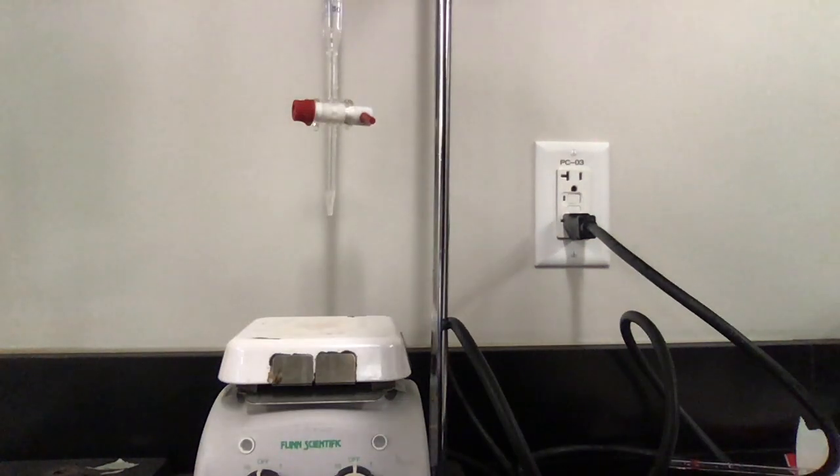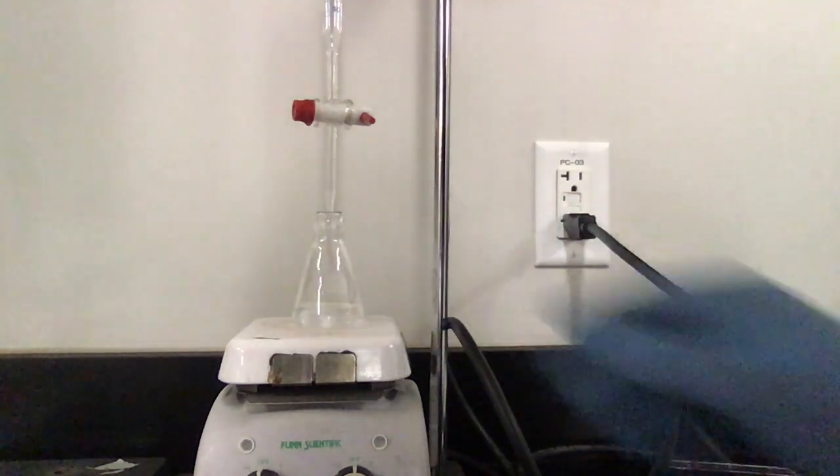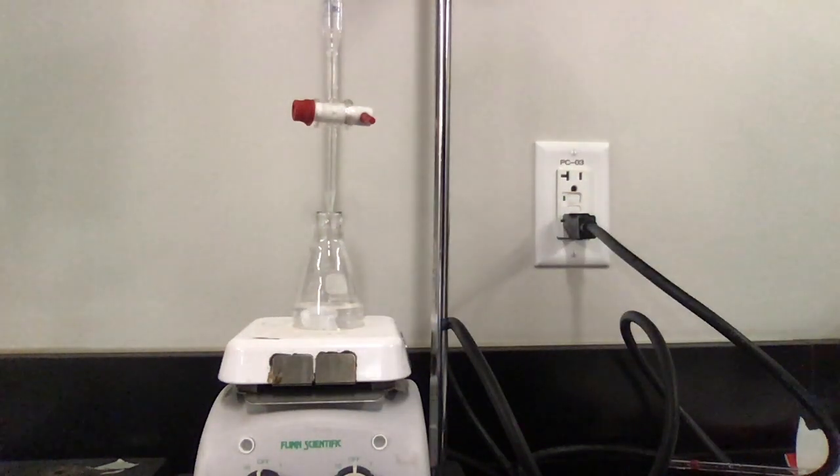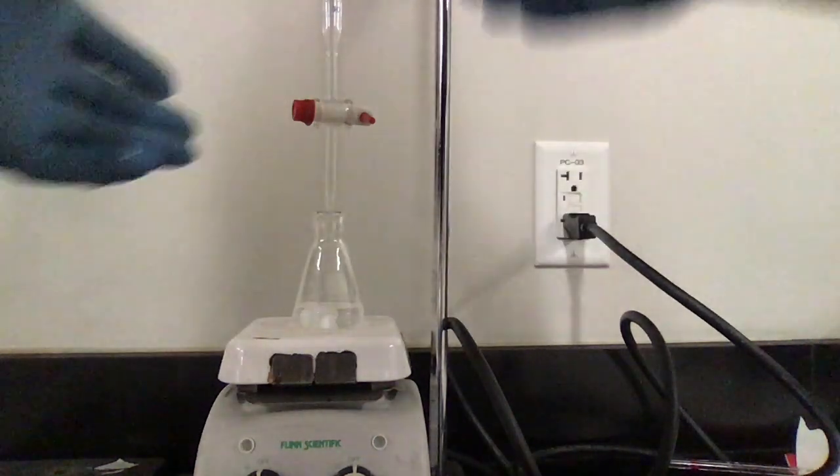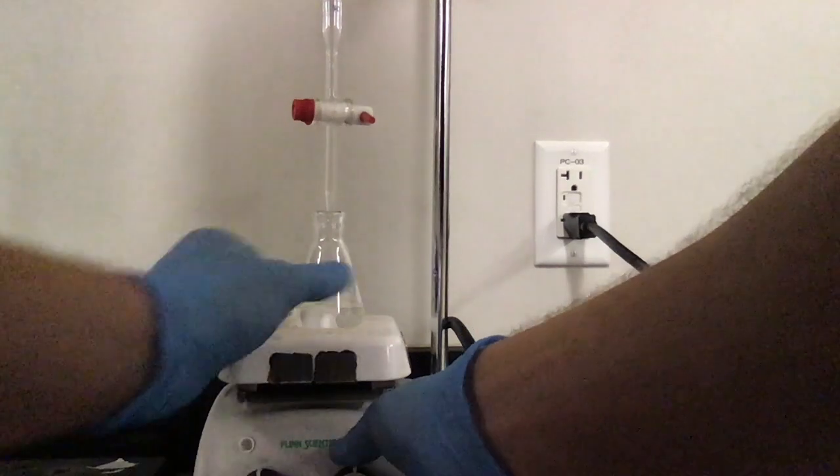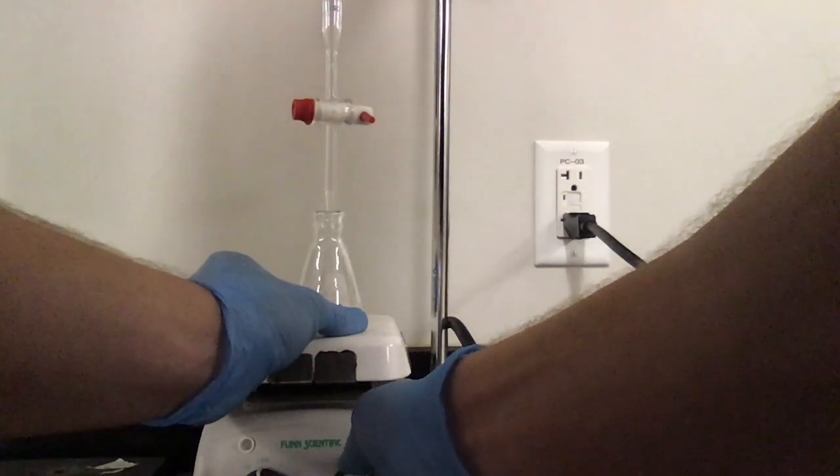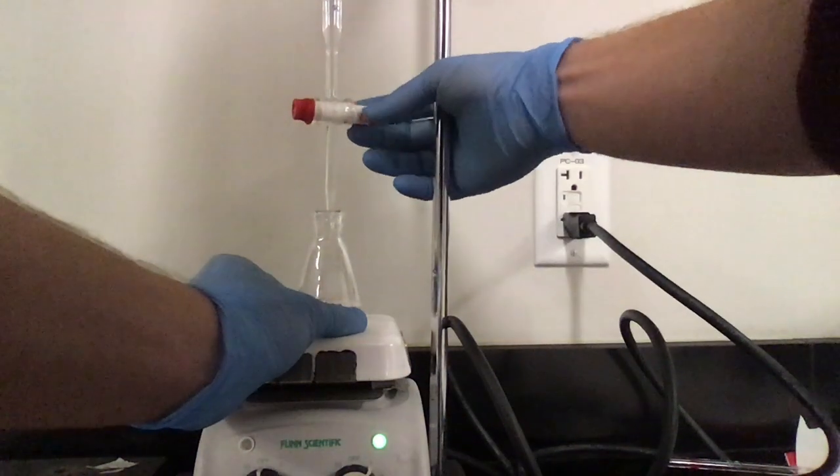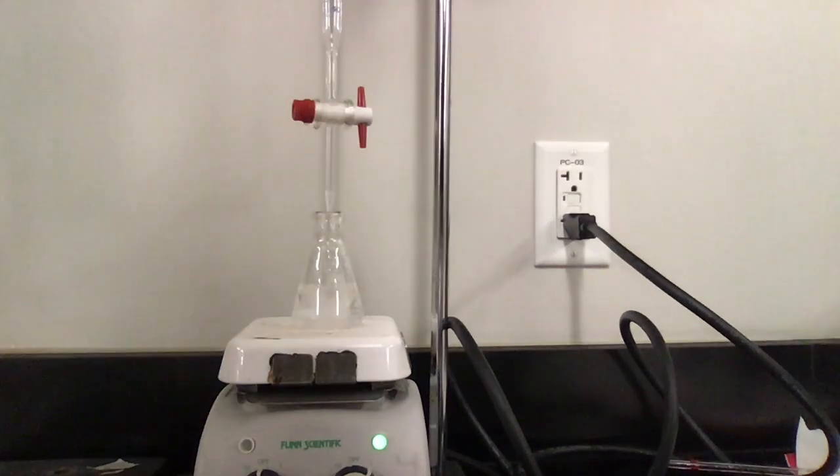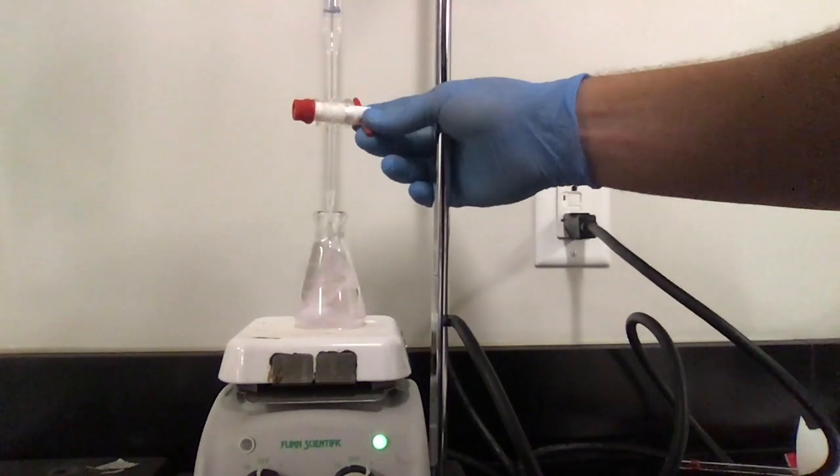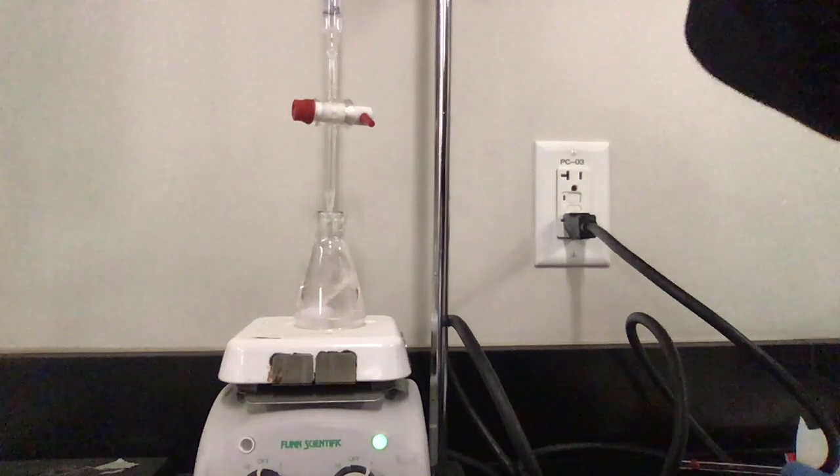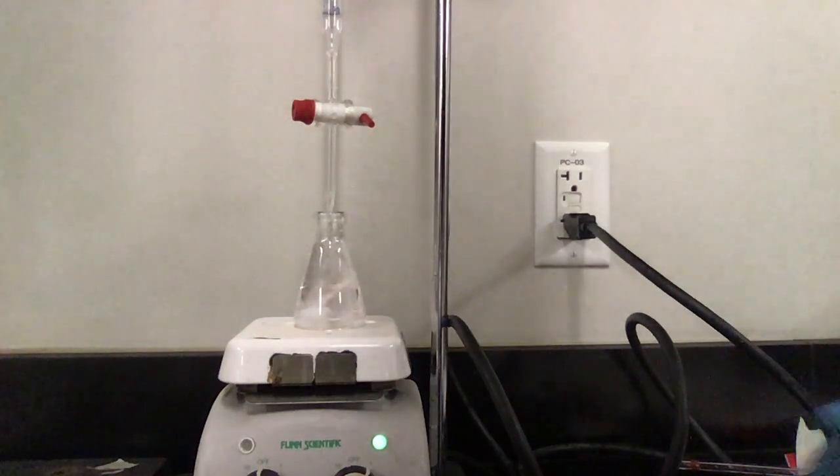Okay. So for this one, I filled up the burette. This is our last titration. I filled up the burette to 24.2. So I filled up the burette. Oh, excuse me. 23.8. So I filled up the burette to 23.8. Keep that in mind. All right. I'm going to start again. Again, I know an approximate amount that I'm going to need. So this should go a little bit faster than the last couple. Okay. I think that that's staying pink. Our measurement. Oh my gosh. Good thing.